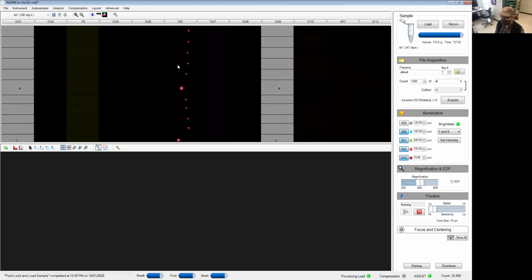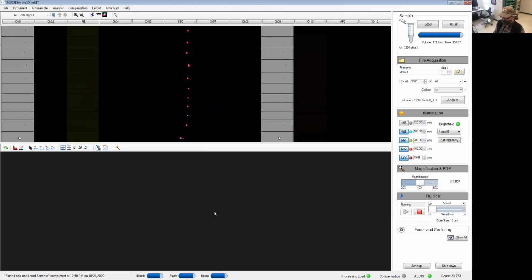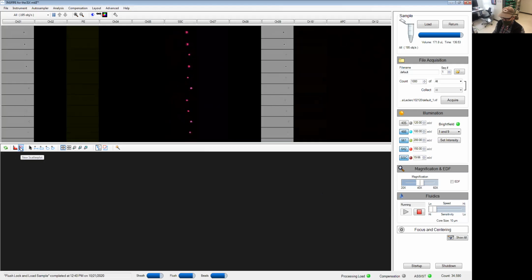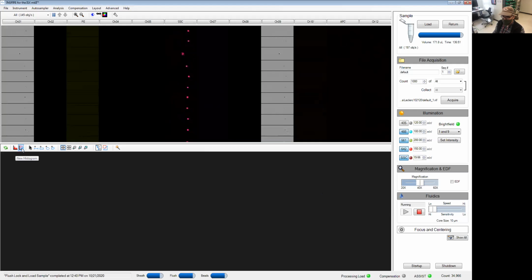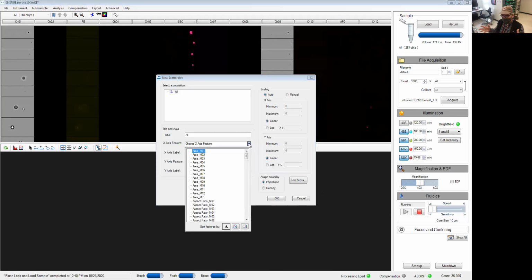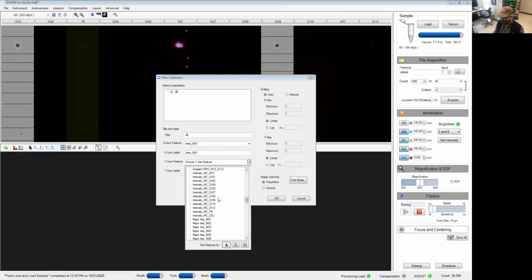signal goes. Now we're going to start making some graphs, so that's what we'll use the lower window here. Two types of graphs you can do, scatter plot and histogram. So we're going to use scatter plots first. There are tons of features we can do here. I'm not entirely sure what each of them do, so I'm just going to give you a quick and dirty way of making sure your position is going to be correct. So we're going to start with area on channel 1 and intensity on channel 6.